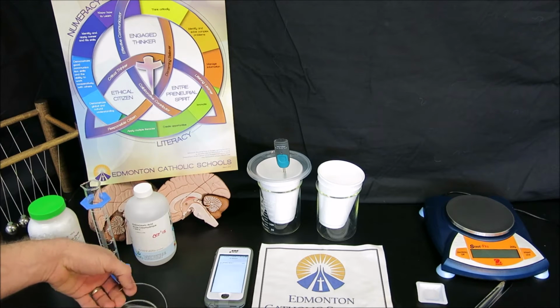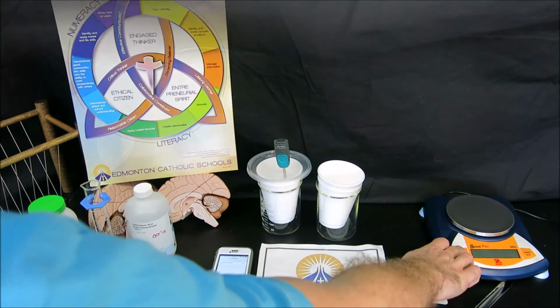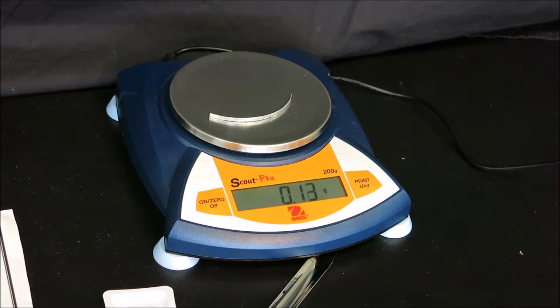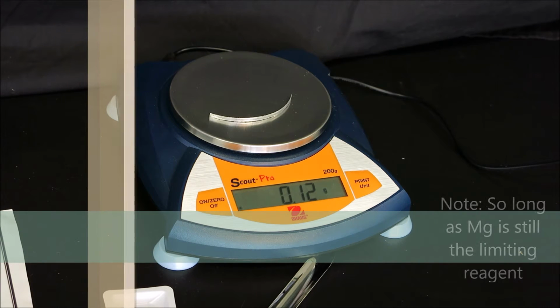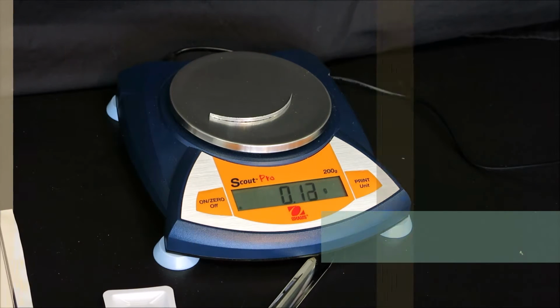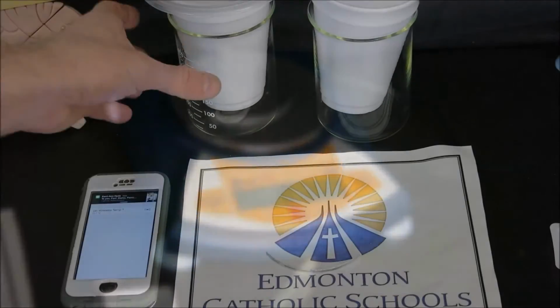The first reaction will be to take a piece of magnesium and weigh it on our scale. The specific mass of magnesium is not crucial because the molar enthalpy of reaction with hydrochloric acid will take into account the mass of magnesium used for the reaction. We can see there are slight fluctuations in the mass, possibly due to air currents in the room, but we will settle on a mass of 0.13 grams.